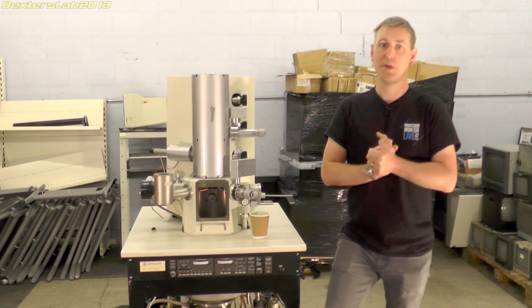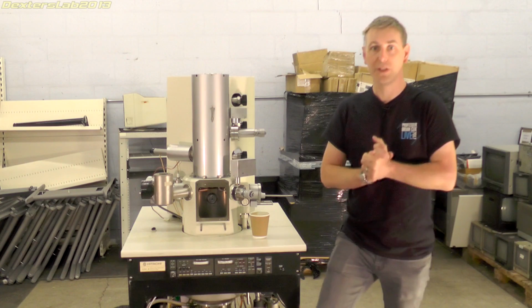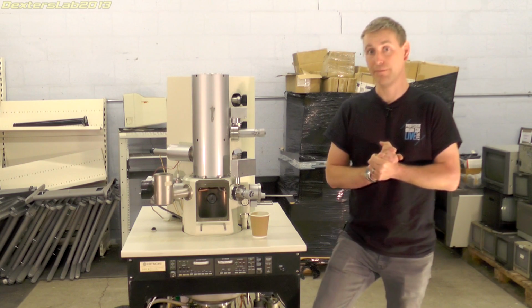If nobody is willing to buy it in that form, then the diffusion pump will be removed and sold separately on eBay to cover my costs of buying this and shipping it to me.